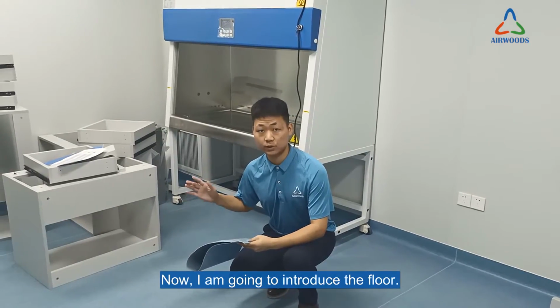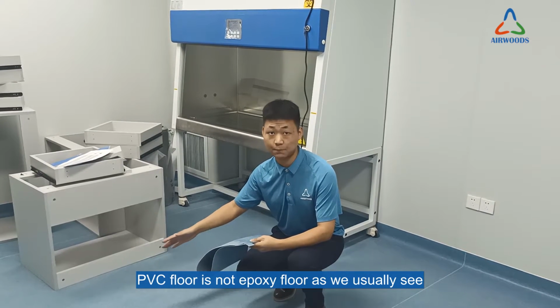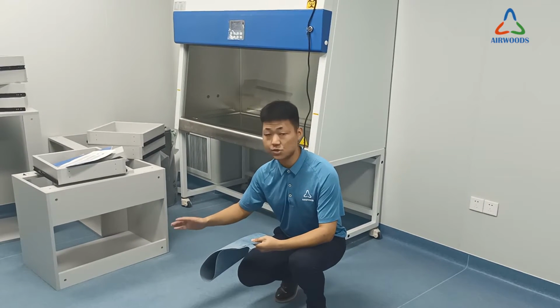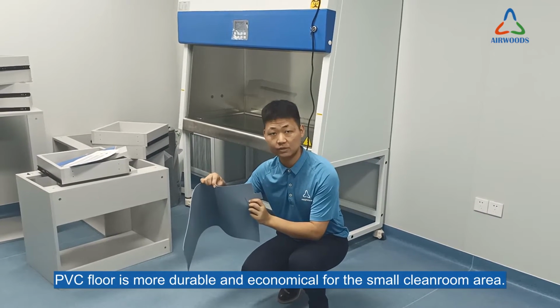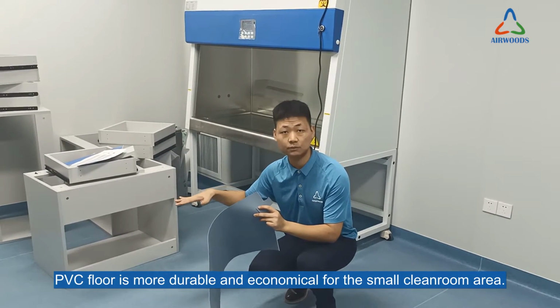Now I'm going to introduce the floor. You can see that this is a PVC floor, not epoxy. Usually we see epoxy, right? Why do we use a PVC floor? Because a PVC floor is more durable and more economical for a small clean lab.